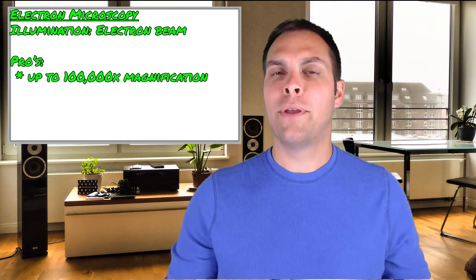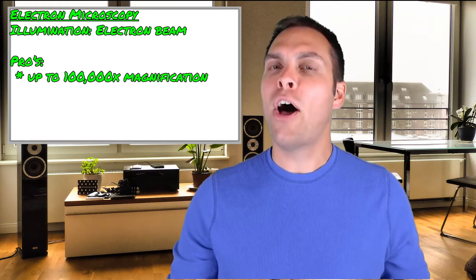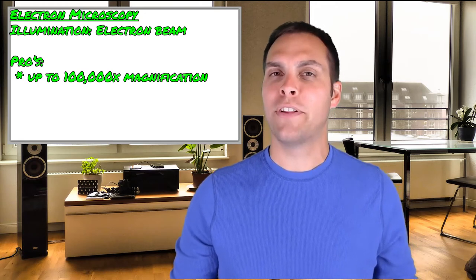If we're going to study things smaller than bacterial cells or want to see what's going on inside cells, we need electron microscopy. Electron microscopy uses a beam of electrons to illuminate the sample — it's actually a lot more similar to an X-ray than to light microscopy. You can magnify specimens up to about 100,000 times, allowing you to see internal structures and even the smallest viruses.